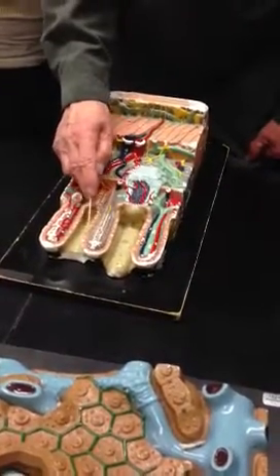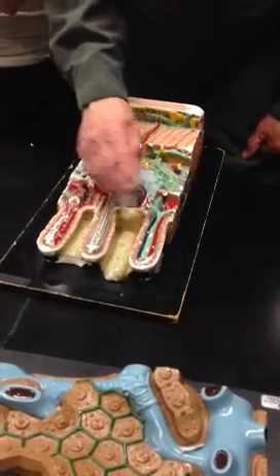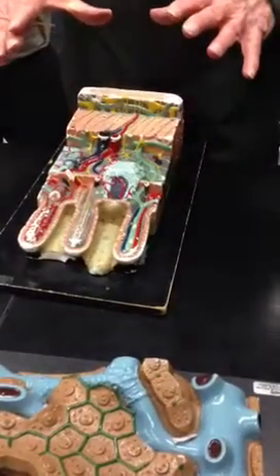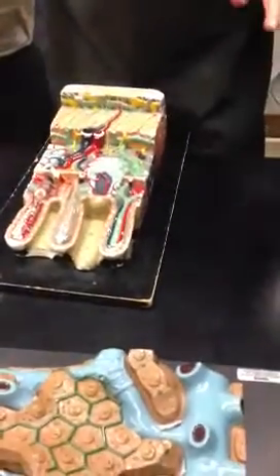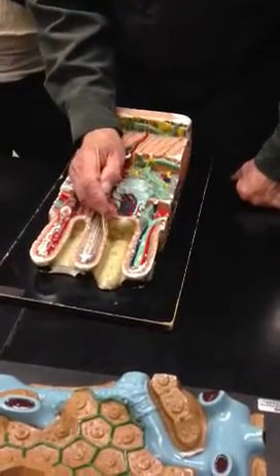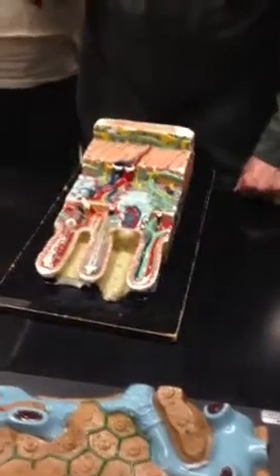And these are columnar epithelial cells. And those columnar epithelial cells, although you don't see it here, this isn't blown up enough. But if you magnified it even more, microscopically, you would see that the open ends of these columnar epithelial cells have microvilli.